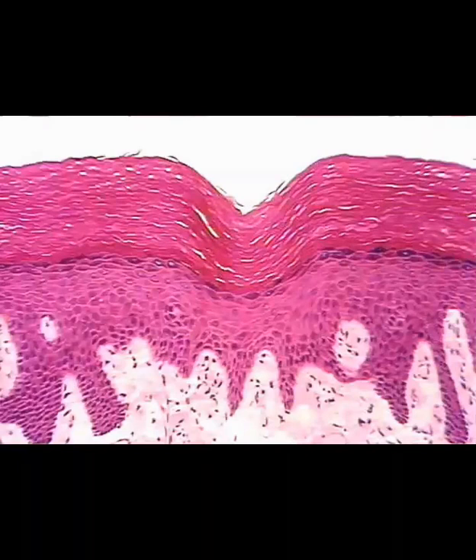And if you look at it, underneath that top layer, you can see a bunch of nuclei, the darker spots in the cells, and keratinized tissue will not have nuclei anymore. So that's one of the things to look for when you're trying to identify the keratinized cells. They will not have nuclei.